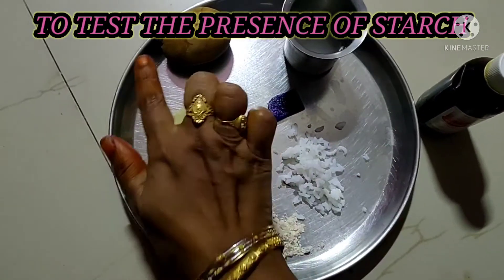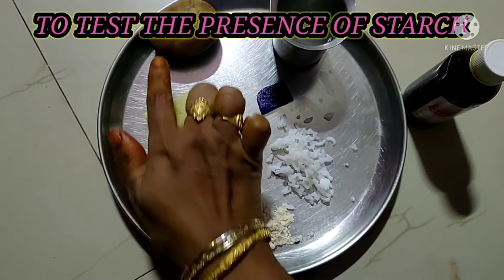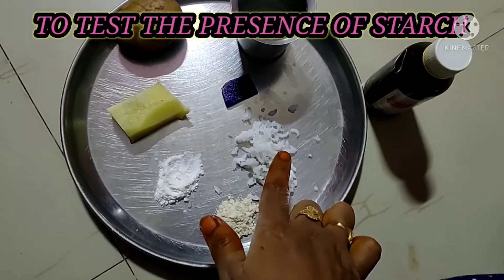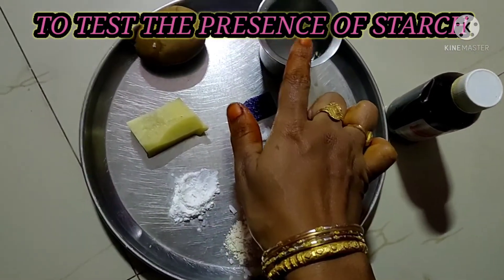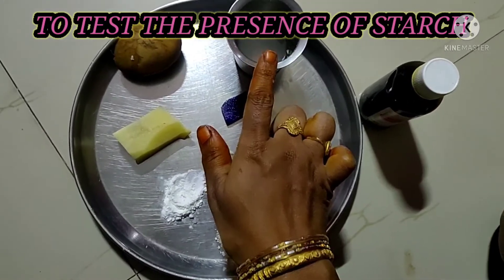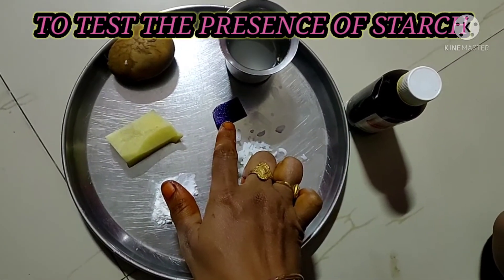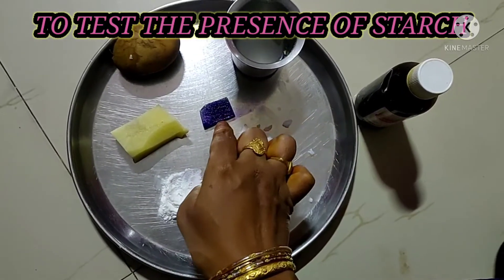The first food item is potato — we take a piece of potato. We also have rice flour, wheat flour, cooked rice, and rice water. If you pour some iodine on these food items, they will turn into a blue color. This is also a potato slice.